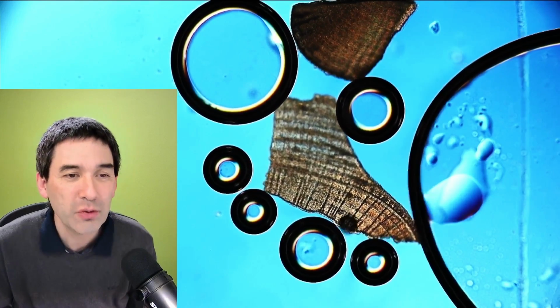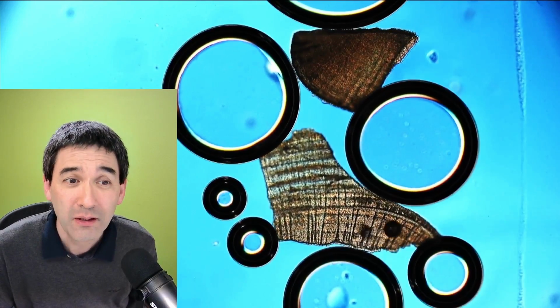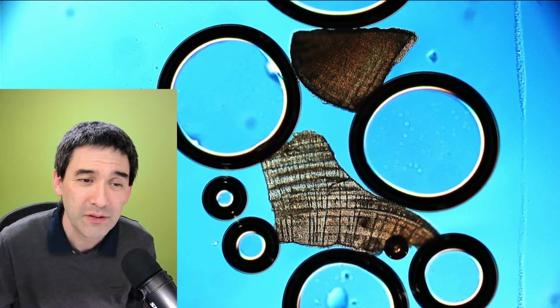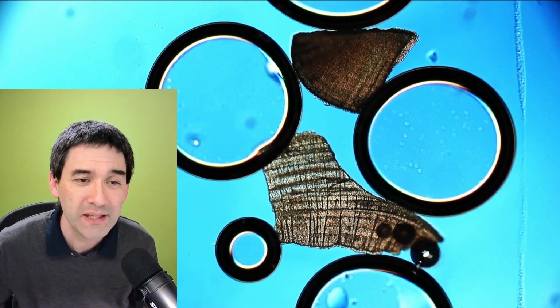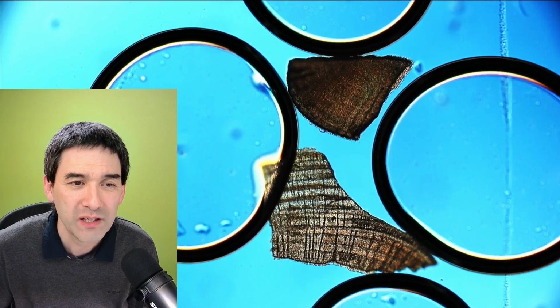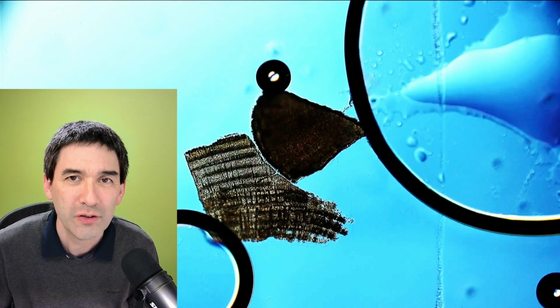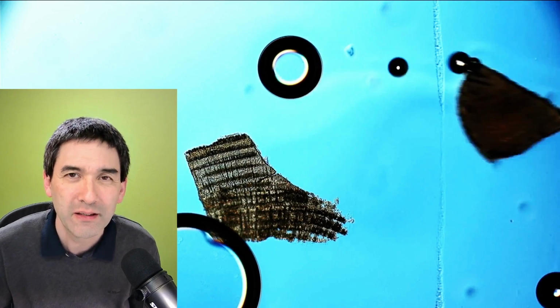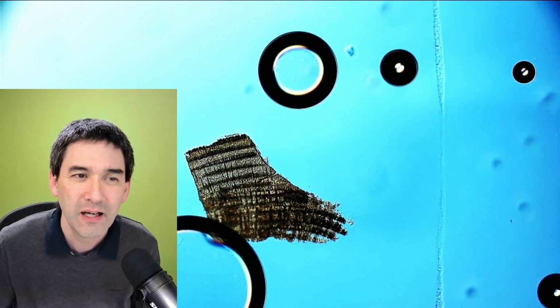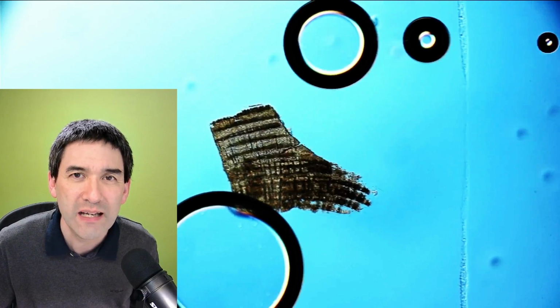Okay, so what I'm going to do now is show you how the whole thing looks a couple of minutes later, because I allowed it to react for several minutes. I'm just going to fast forward carefully. You see how the bubbles become larger. I'm just fast forwarding now. And look, over here you can already see that the edges started to become fairly transparent and quite fuzzy. You can see especially at the edges, the fragment is already quite dissolved.